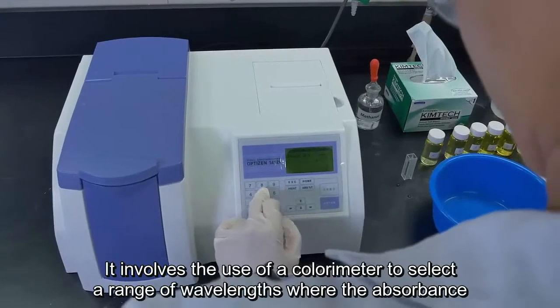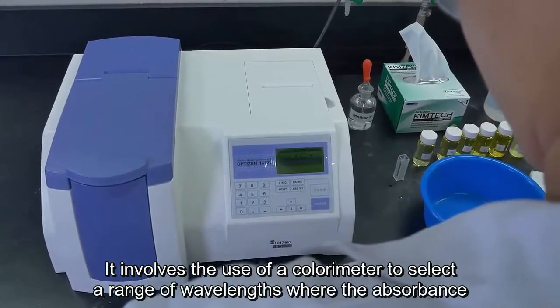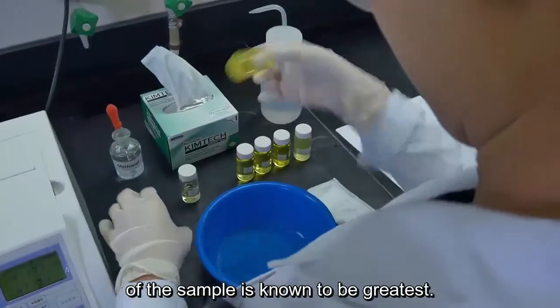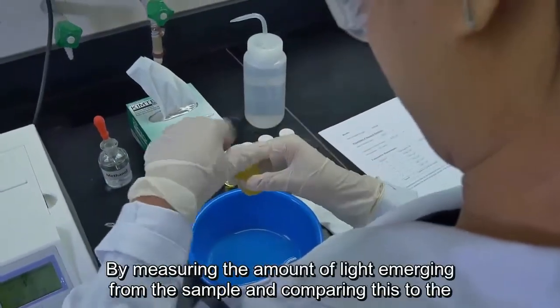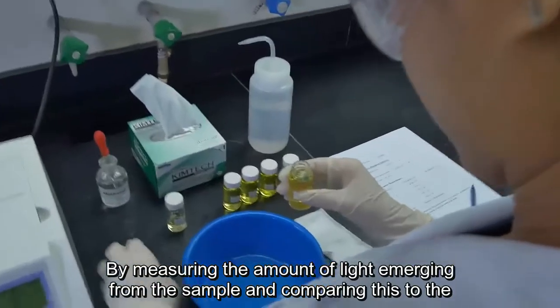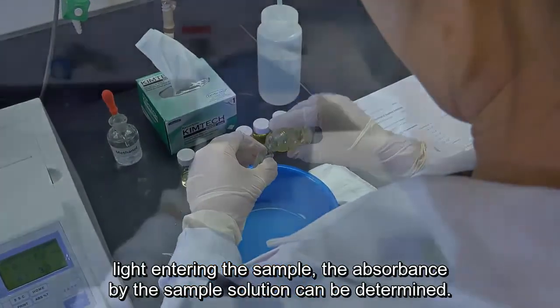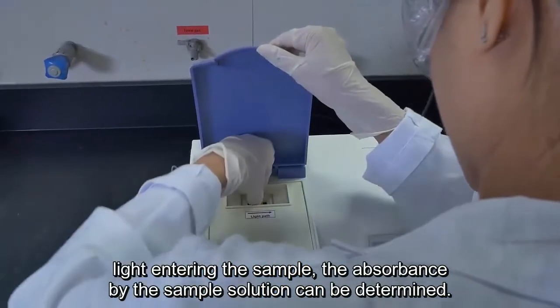It involves the use of a colorimeter to select a range of wavelengths where the absorbance of the sample is known to be greatest. By measuring the amount of light emerging from the sample and comparing this to the light entering the sample, the absorbance by the sample solution can be determined.